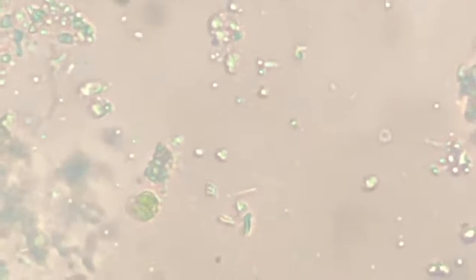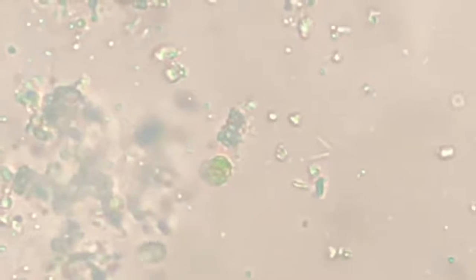And it is somewhere here. It is here. It is somewhere here. I'm just missing it out. Not able to focus. Yes, probably. Probably. Need to focus. Find it where it is. And I think I have lost it. Or have I? No, I have not.